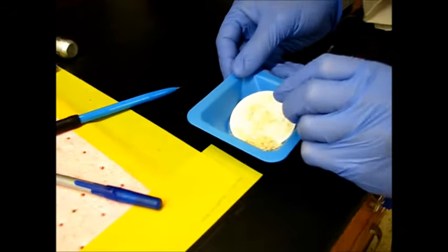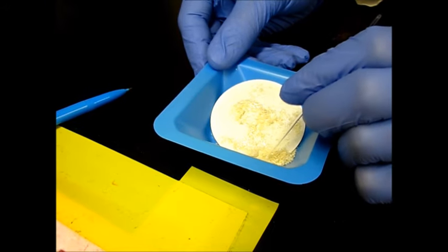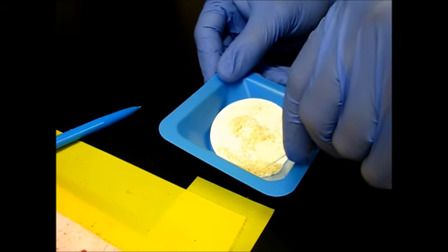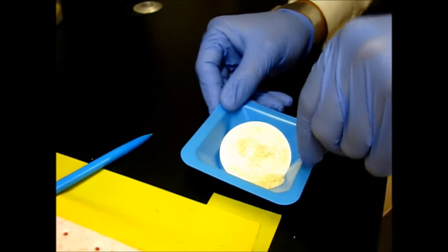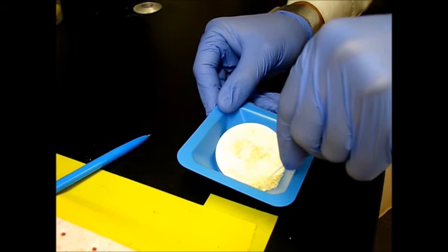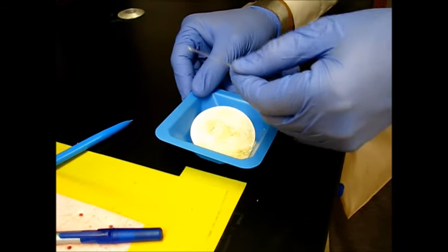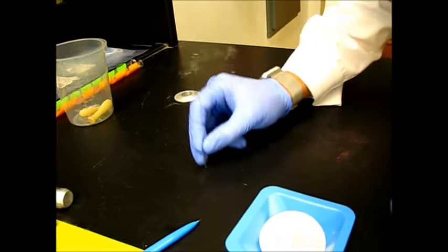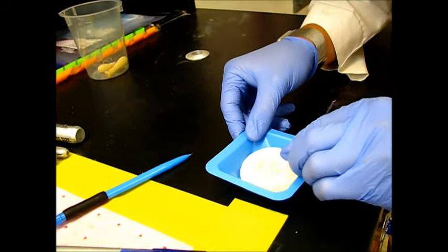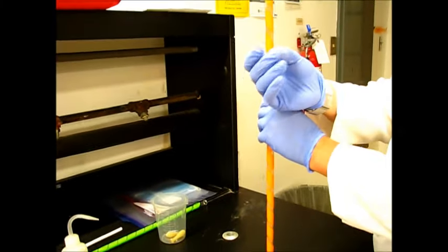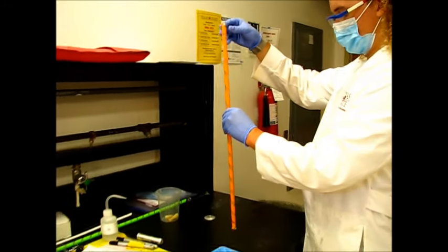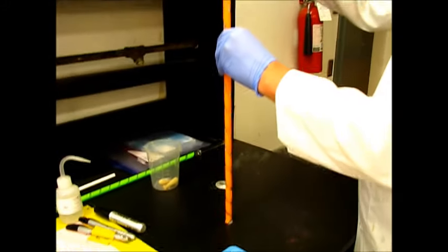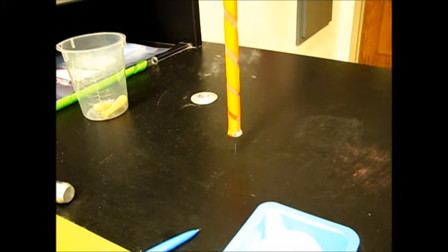So now that we've got the mass of our product, we're going to get the melting point of it. So to do that, we're just going to cram a little bit of the product into the tip of this capillary tube. Got some in there. Okay. You can't drop it upside down. Yeah. And then we have to take the melting point? Yes. Okay, we have to do this. So once we've got a little bit of it loaded in there, we're going to drop it down this burette so that it will bounce without falling over. And then we can repeat this multiple times until all of the solid is down at the bottom.